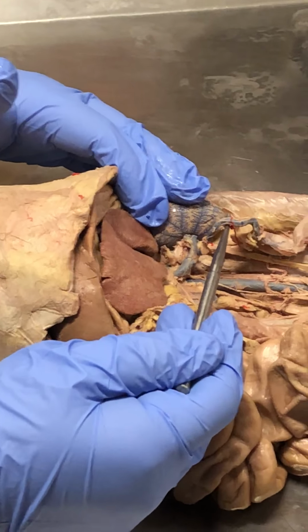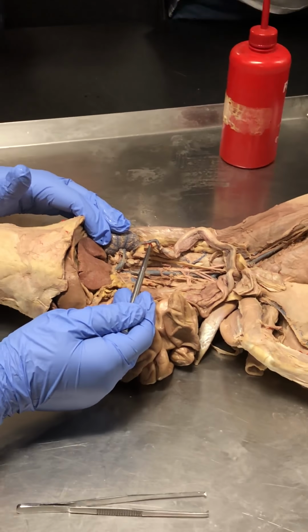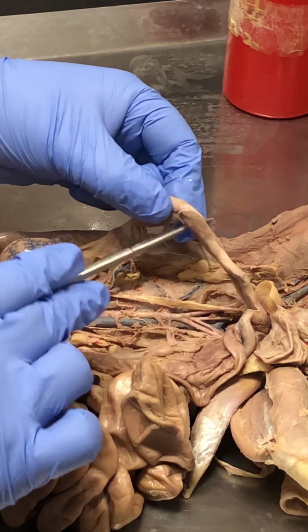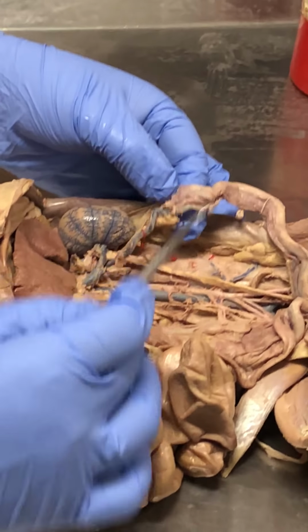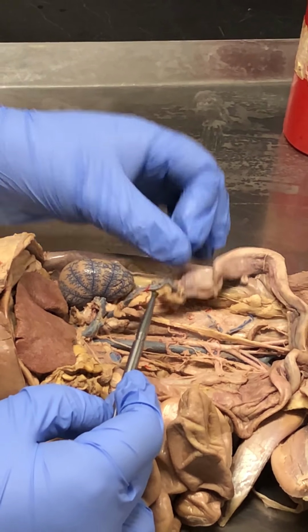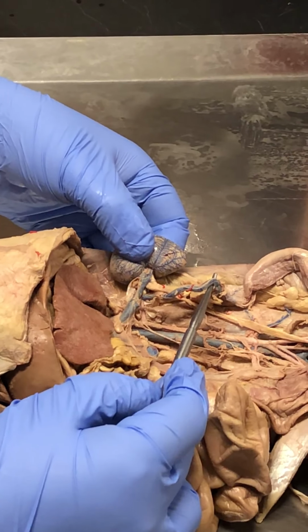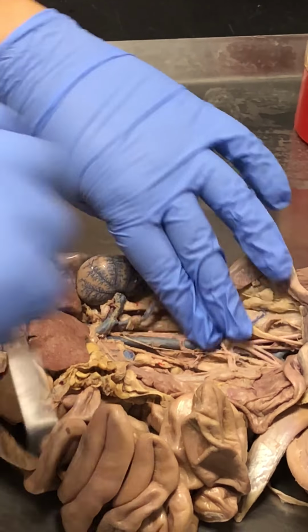So this vessel you see here, that is the left renal vein. Sorry, left ovarian vein. This is female. This is the uterine horn, and the uterus is this V thing. But this is the uterine horn, and the ovaries over here. So this vessel is going to the ovaries. So this is the left ovarian vein. And take a look where it's going to dump into. It's going to dump into the left renal vein, just like I drew it. Same thing with the cadaver over there. Okay? So take a look at that and then travel downwards.